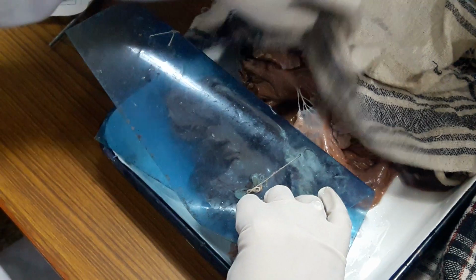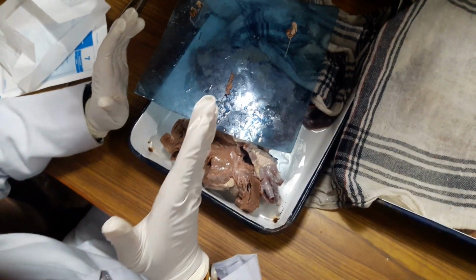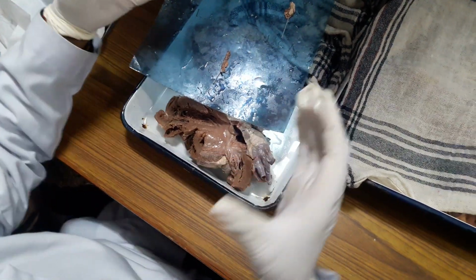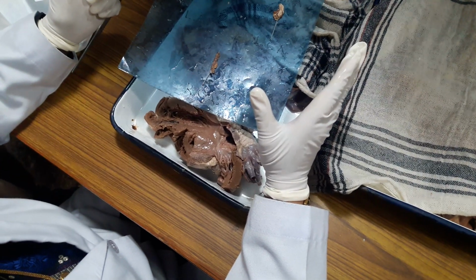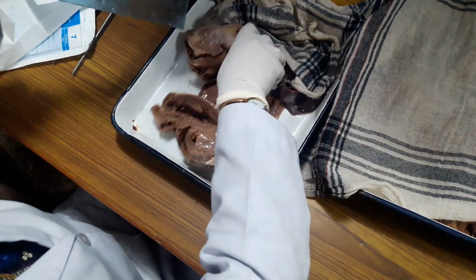Okay, now this is another case. This belongs to the case study. Okay, so it is mandatory to see the heart proper with its complications. Then you have to see the artery also. To see the supplying artery, we give 1 to 2 millimeter cuts serially, and we try to see what has happened to the plaque. Usually there is a plaque with either a plaque rupture or plaque erosion with thrombosis. Rarely there can be intraplaque hemorrhage.